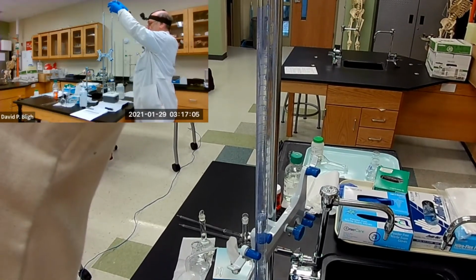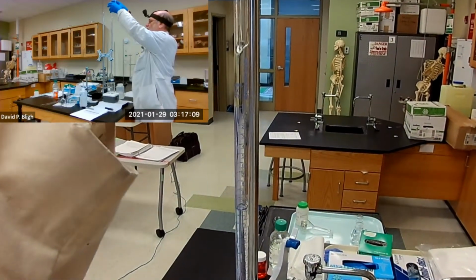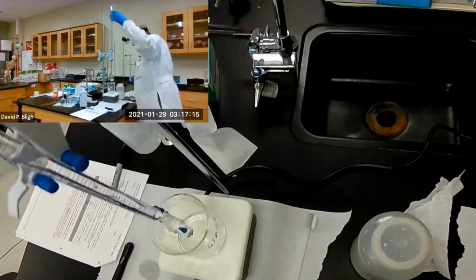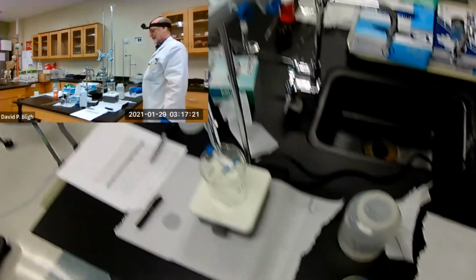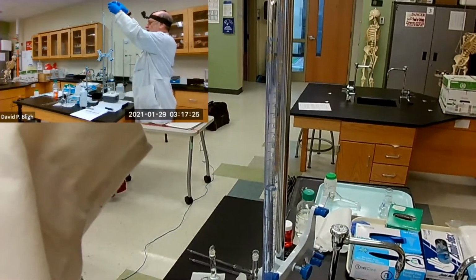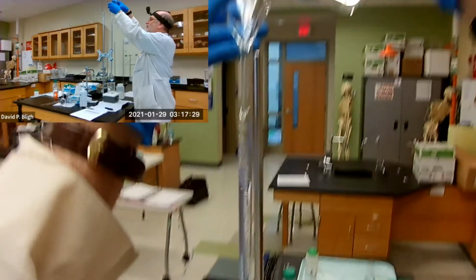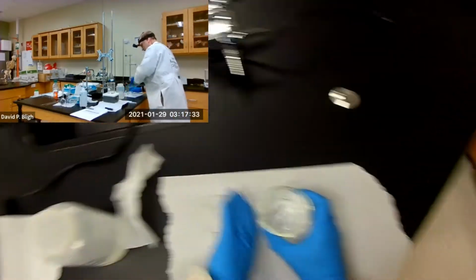Okay. More. Uh-oh. It's draining because I left the stopcock open. Imagine that. I'll tell you why that was not a completely bad thing in just a second. Here we go. All right.